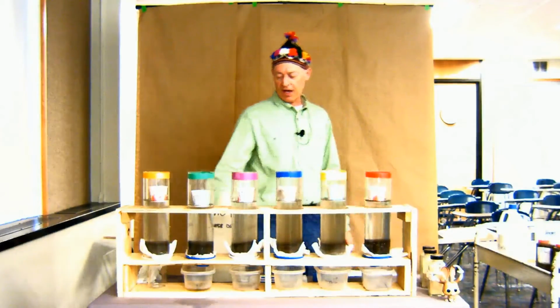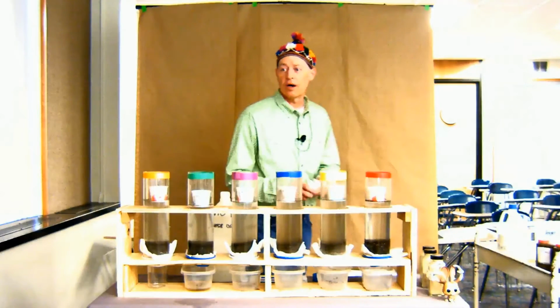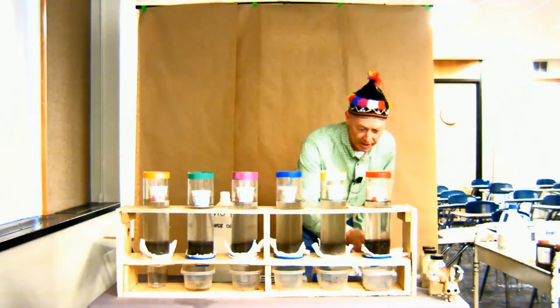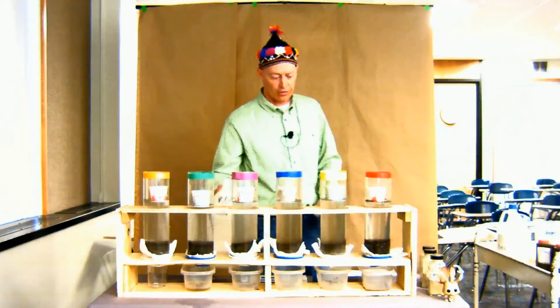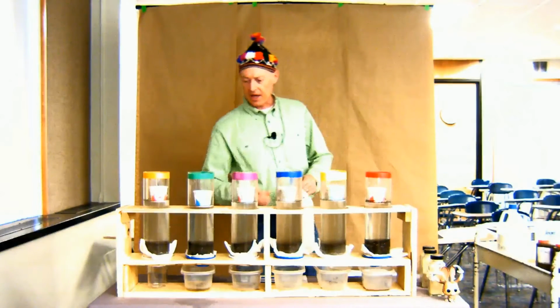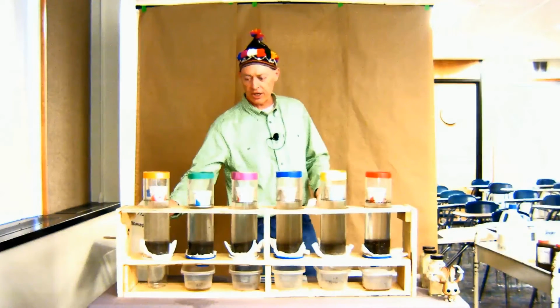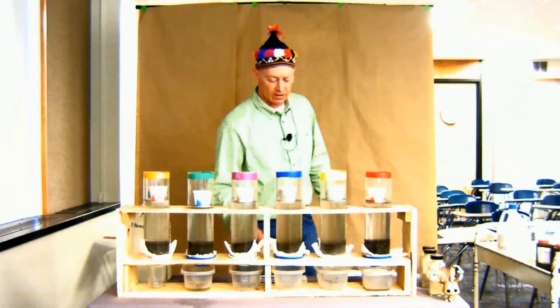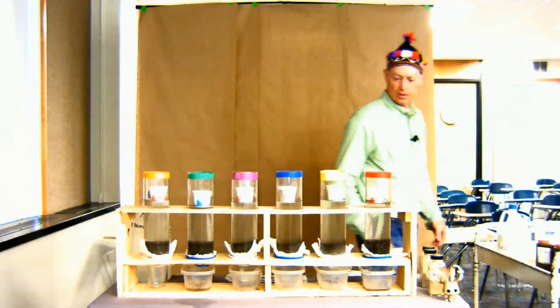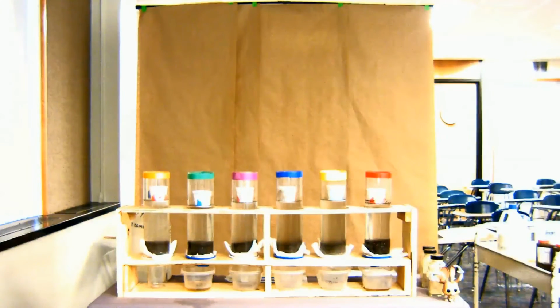You can have a high electrical conductivity and water will move through just fine. Water's already moving through on the coarse textured one and on the calcium chloride one. So you'll be able to watch now the change in height of those cups. Okay, so we're going to let that stew and fester, and we'll monitor that.